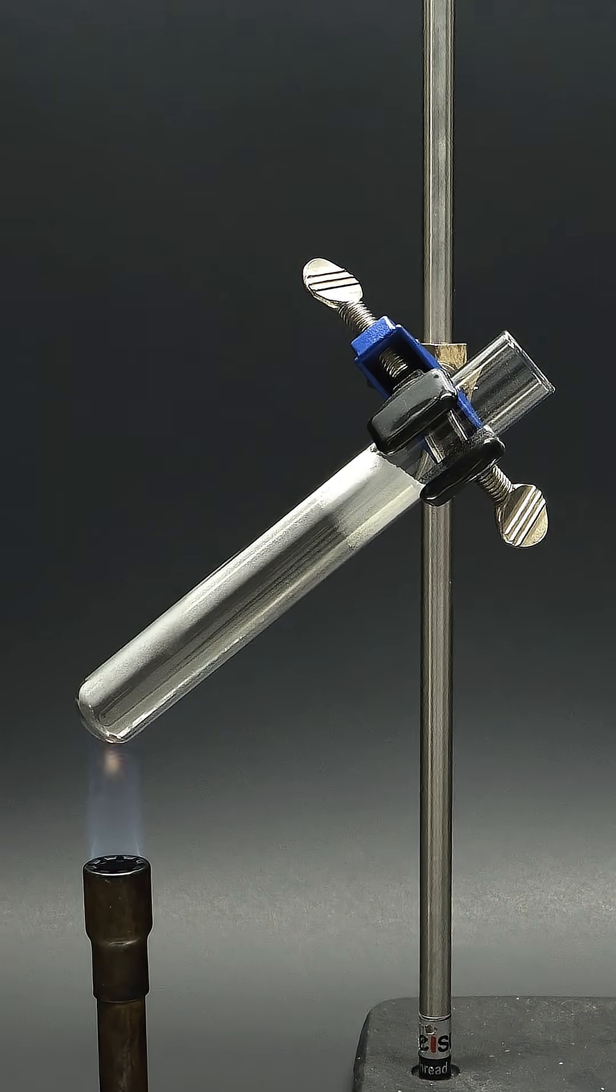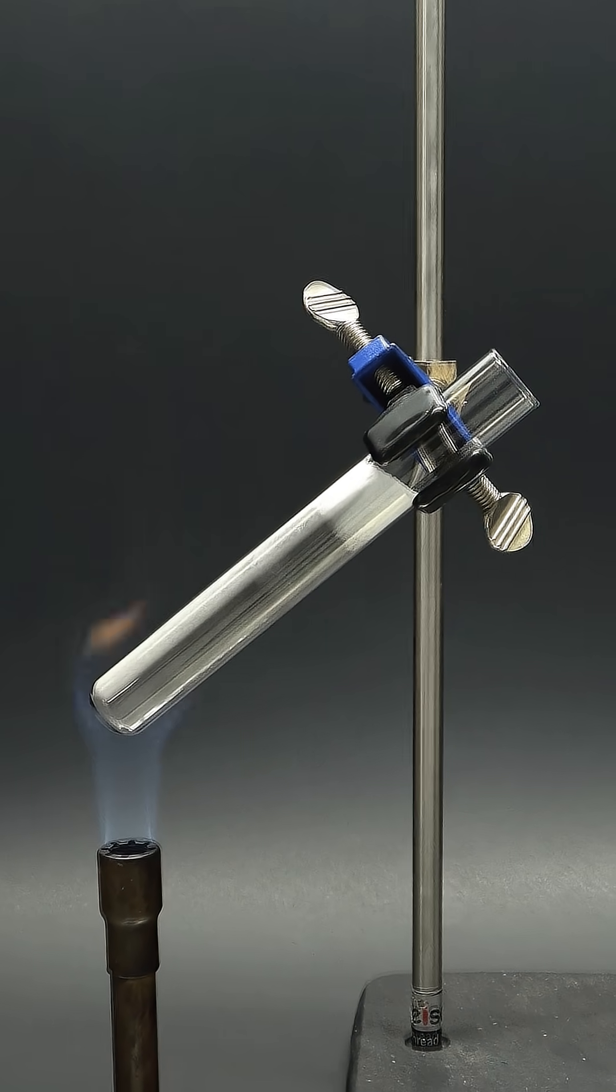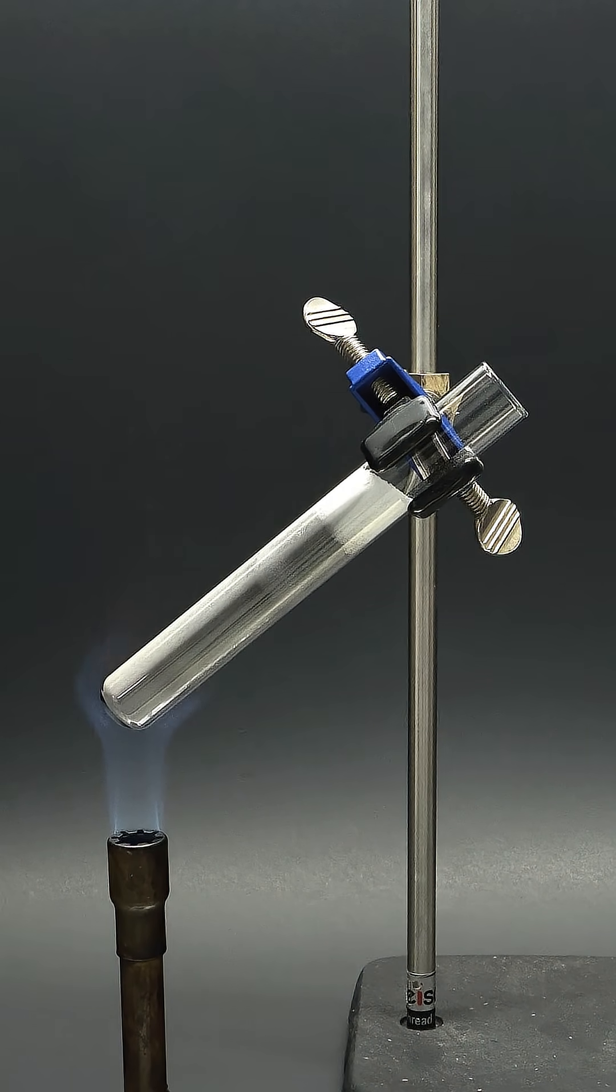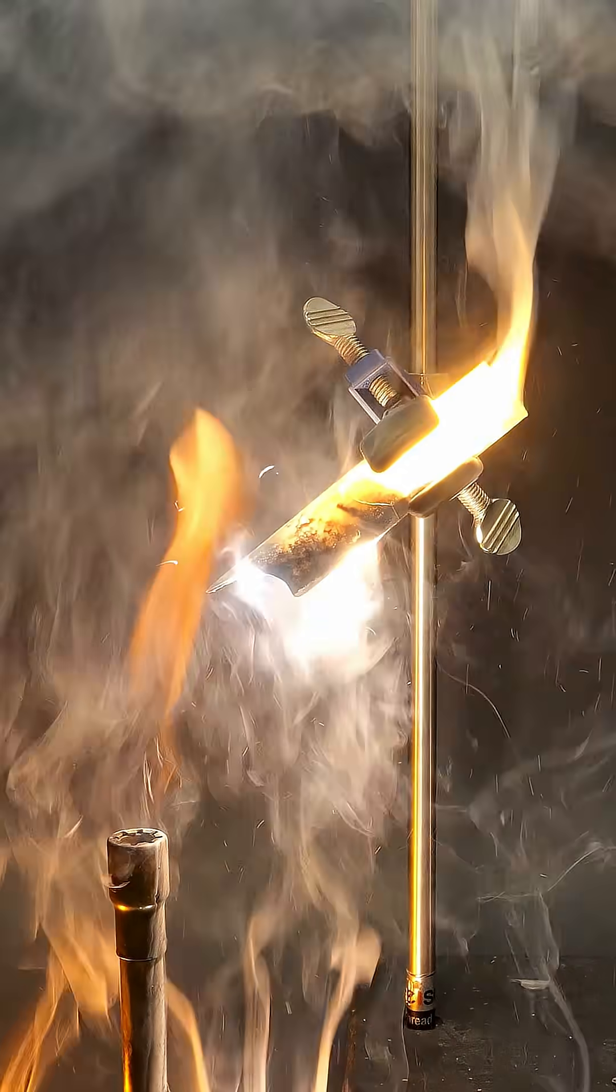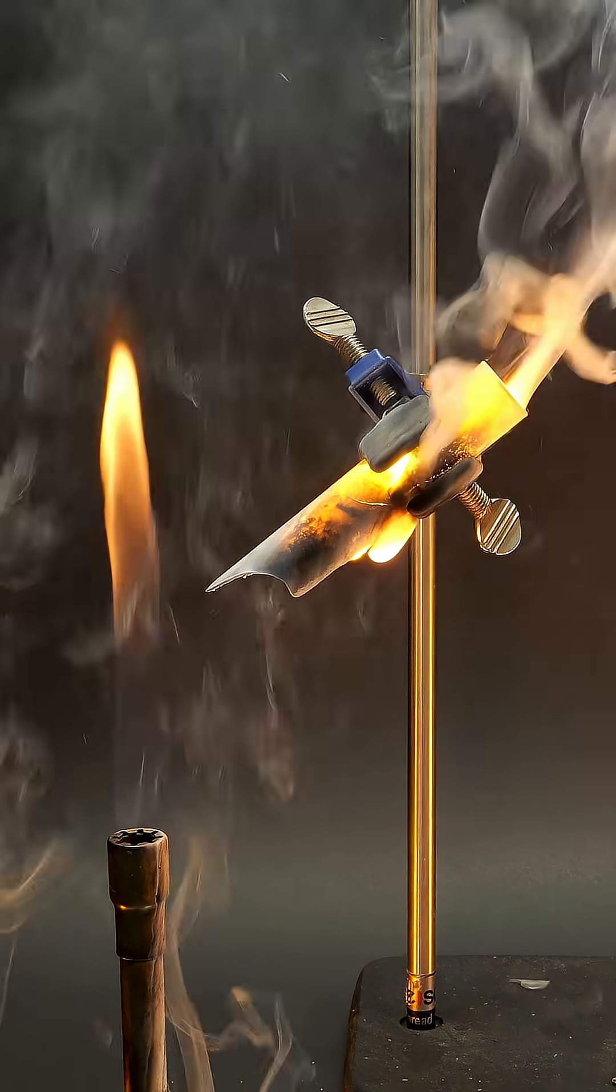With all of this in place, the sand and magnesium should slowly heat up and gently react. Except that isn't exactly what happened.